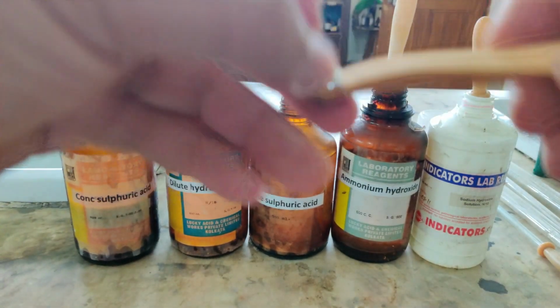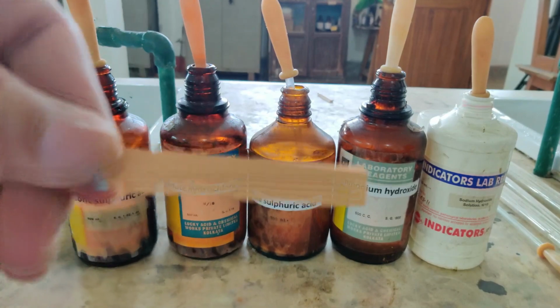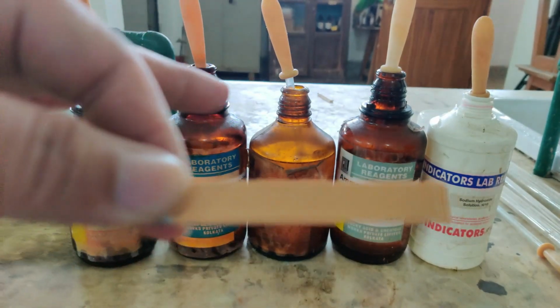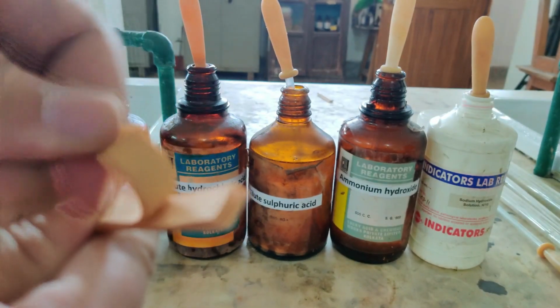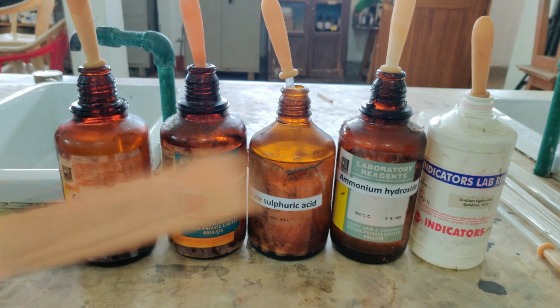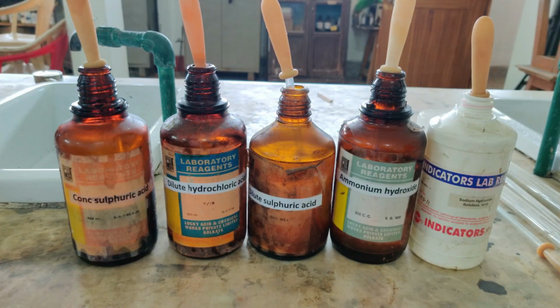Now it has many strips. Last time when I was teaching you theory, I was telling you about this strip, and by the way, it is neither red litmus nor blue litmus. So it is your universal indicator, containing many strips of paper. By looking at the color change of this paper, you should find out what the pH value is. It will take a little time to dry up.